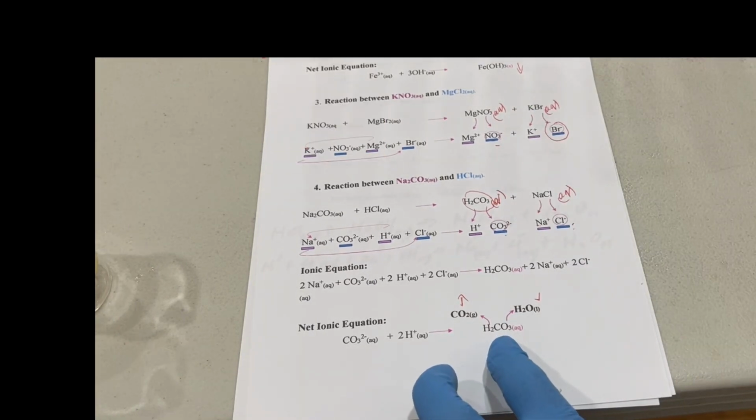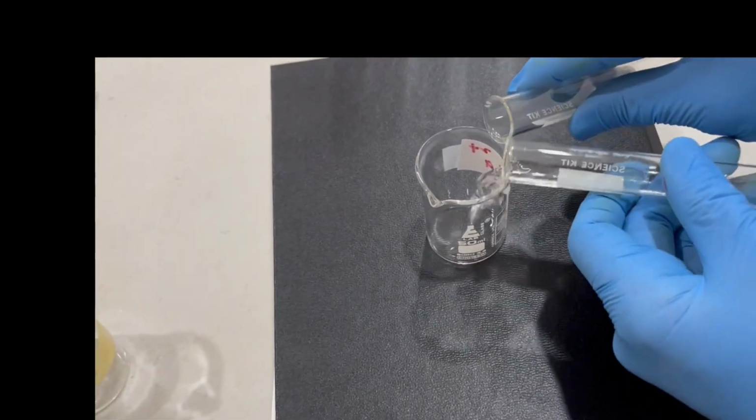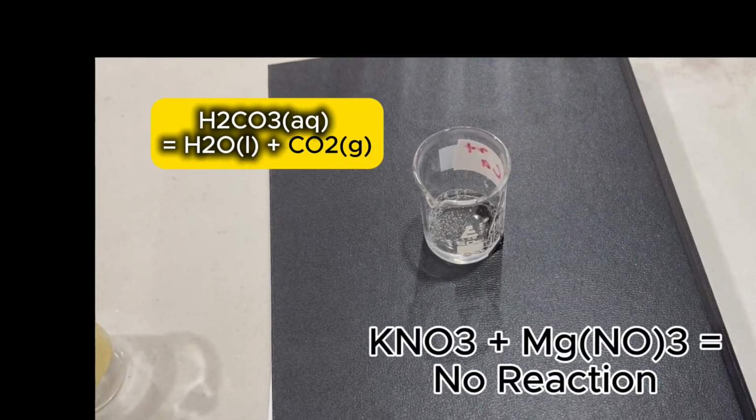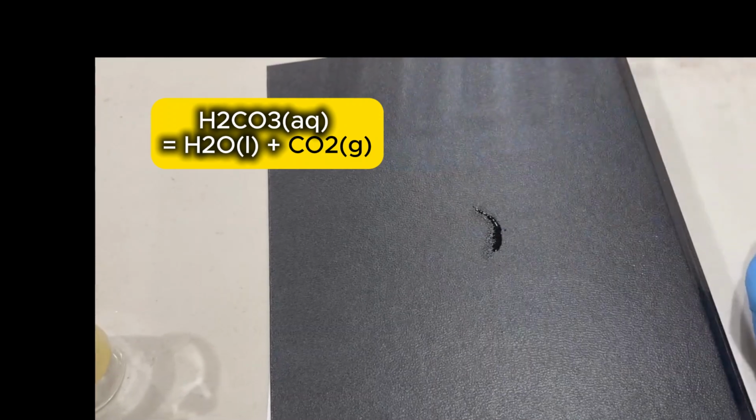Let's do that reaction, see what happens. We're expecting some effervescence to take place. We see some bubbling taking place. See that? So you did see effervescence happening. The gas that comes off there is carbon dioxide.